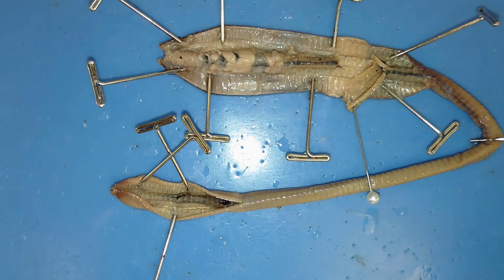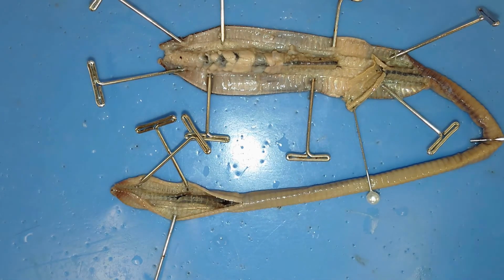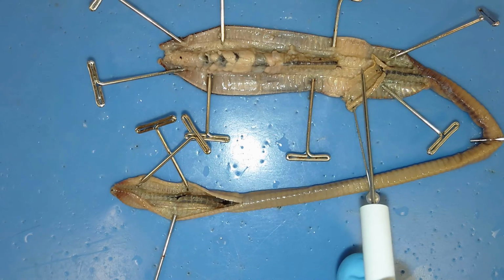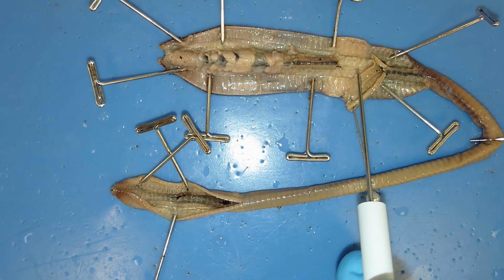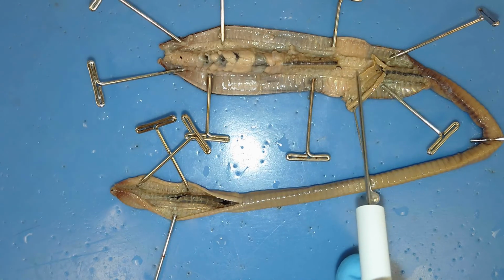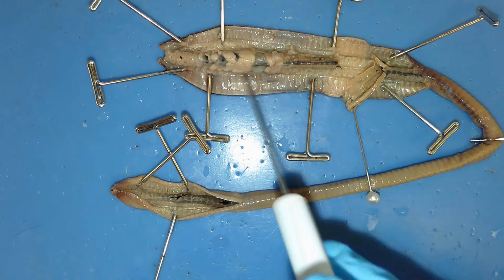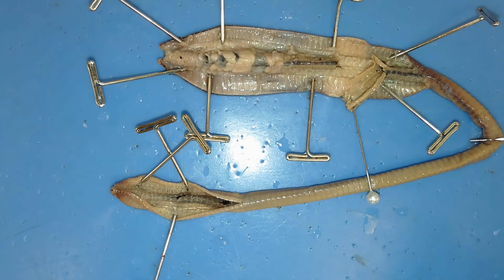And that's just this condensation of nerves at the very front where it controls the rest of the body's movement, what organs are functioning at what time, and stuff like that. And it's sending all these nervous impulses down through this structure right here. Let's see if I can pull it out a little bit without tearing it. So this thin white line, I don't know if you can see it in the video, but this thin white line is what we consider the ventral nerve cord. This ventral nerve cord runs from the brain down the length of the body and branches off to each segment so it can control the movement of each segment or the organs found there.